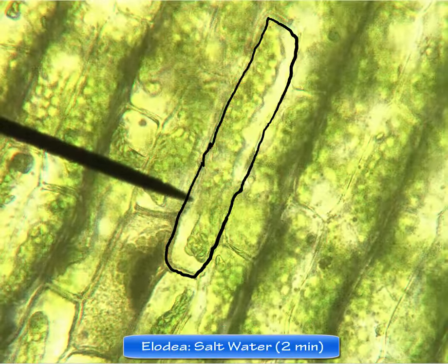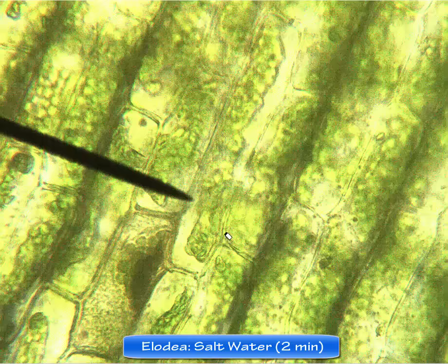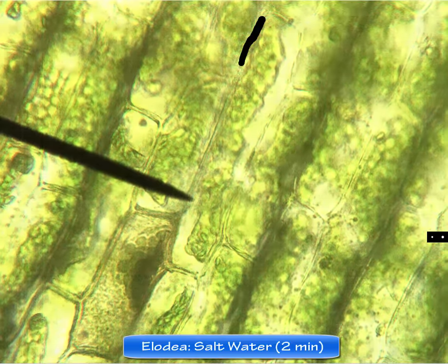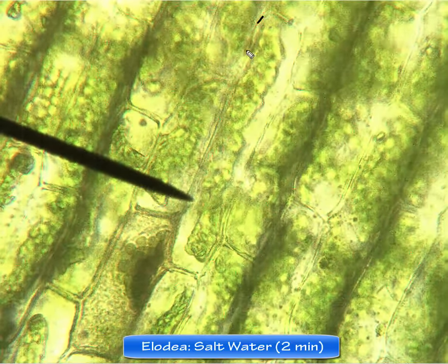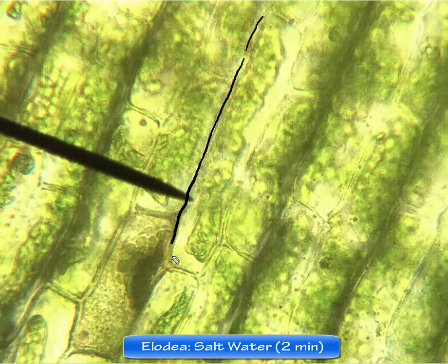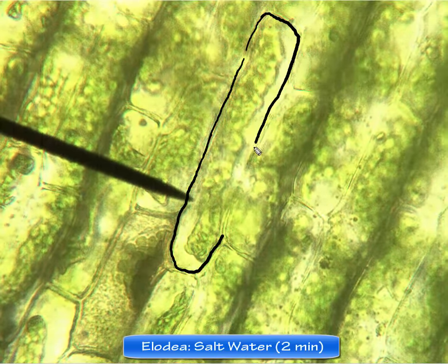And you'll see, I'm going to go ahead and erase our line, but you'll see that our cell wall is still there. And so I will go ahead and draw real quickly our cell wall here. Well, let's use a smaller marker. Let me undo that. And I'm going to quickly draw our cell wall through here. Here we have it all along there, coming down around here, moving up across there, and there we go. It follows all the way down here.